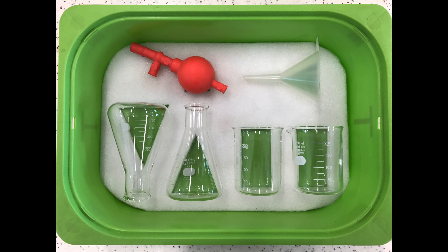Here are the apparatus we will need. We have two conical flasks, two beakers, filter funnel, as well as a pipette filler.